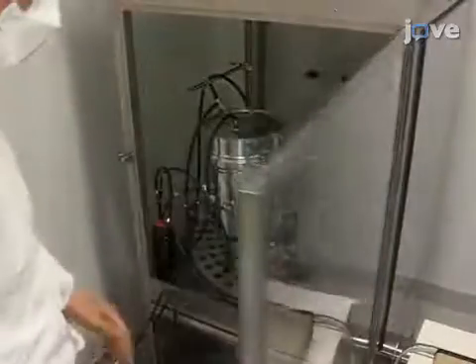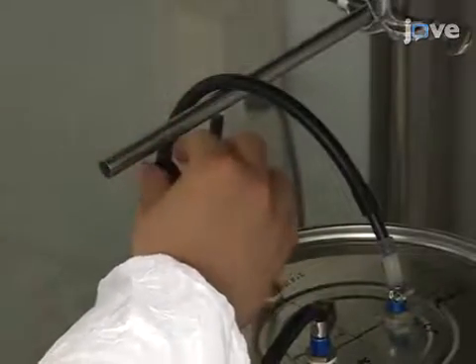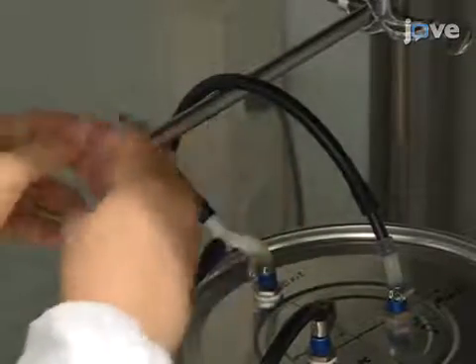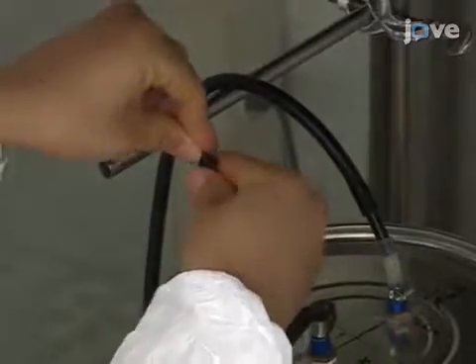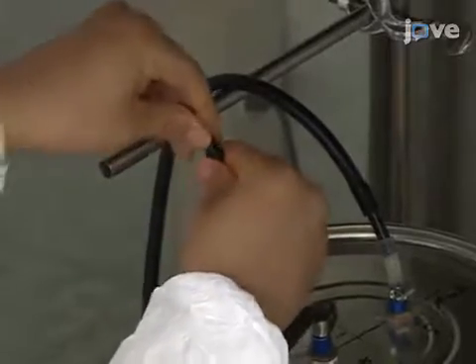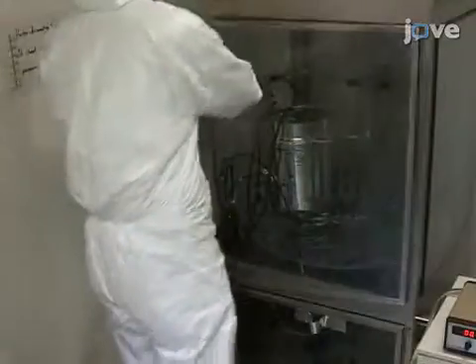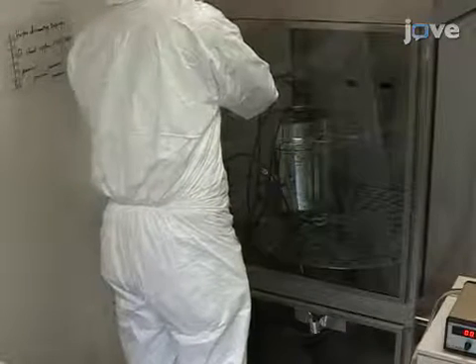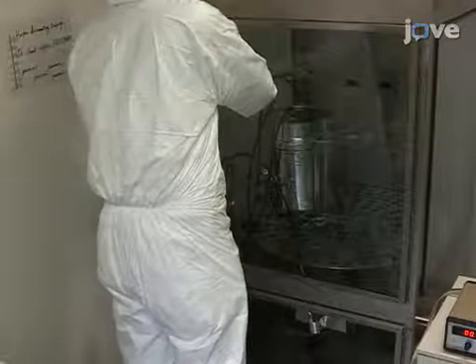Next, go to the sampling and exit tube outlets and use stoppers to close the outlets. Before proceeding, make sure the measurement instruments are ready for use.